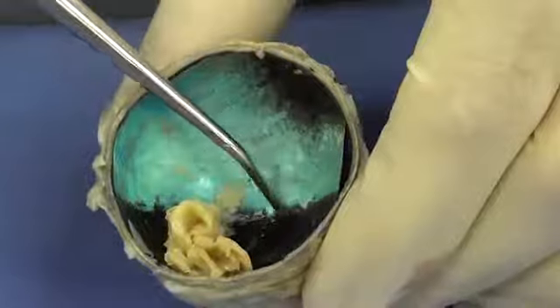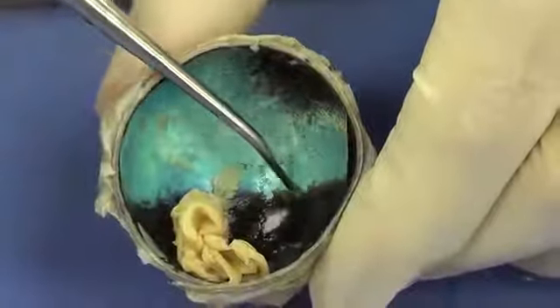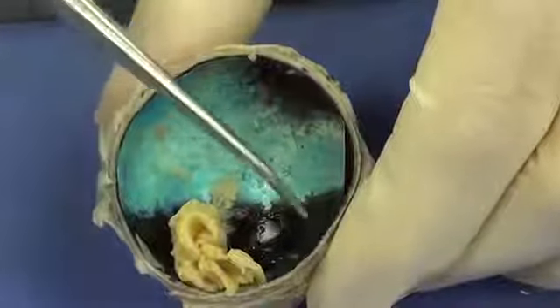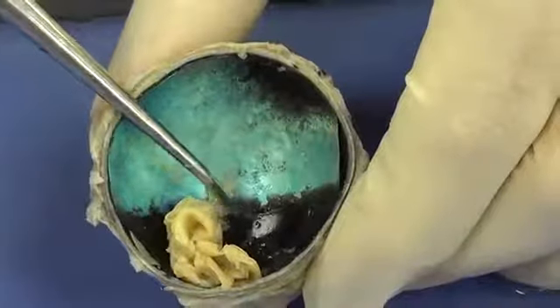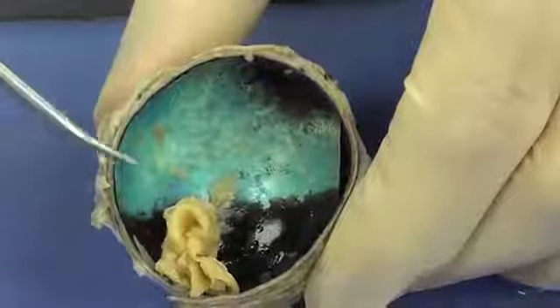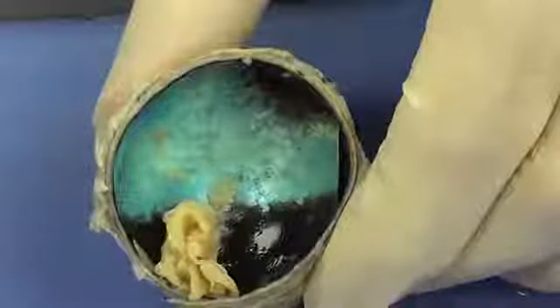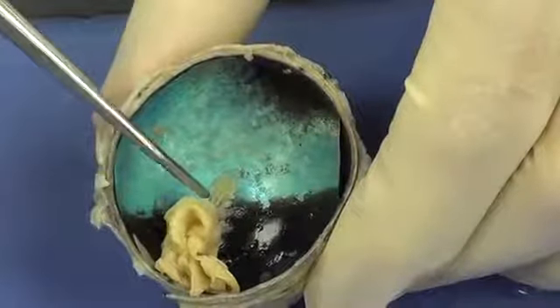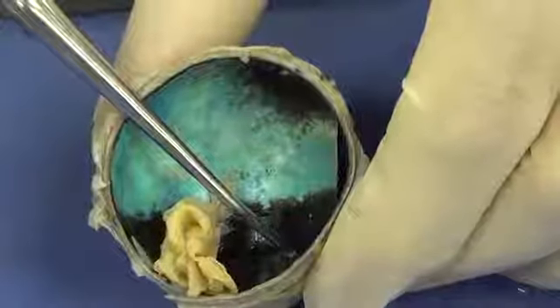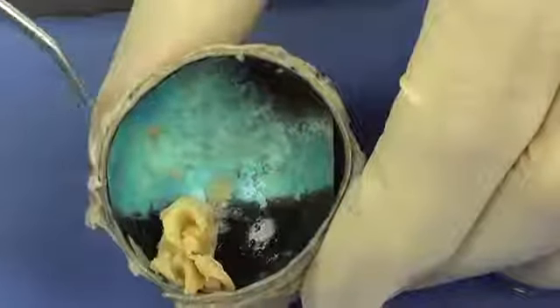Now if I remove that, actually the tapetum is going to be continuous with this other black layer you see here, that's called the choroid. The choroid is very vascular, contains a blood supply that serves the eye. The black color of this choroid also serves to absorb light. So when light comes into the eye, a lot of it is going to strike the retina and get absorbed, but extra light that passes between the nerves of the retina is actually going to strike this choroid and get absorbed, so it's not reflected around the inside of the eye and we don't have blurry vision.